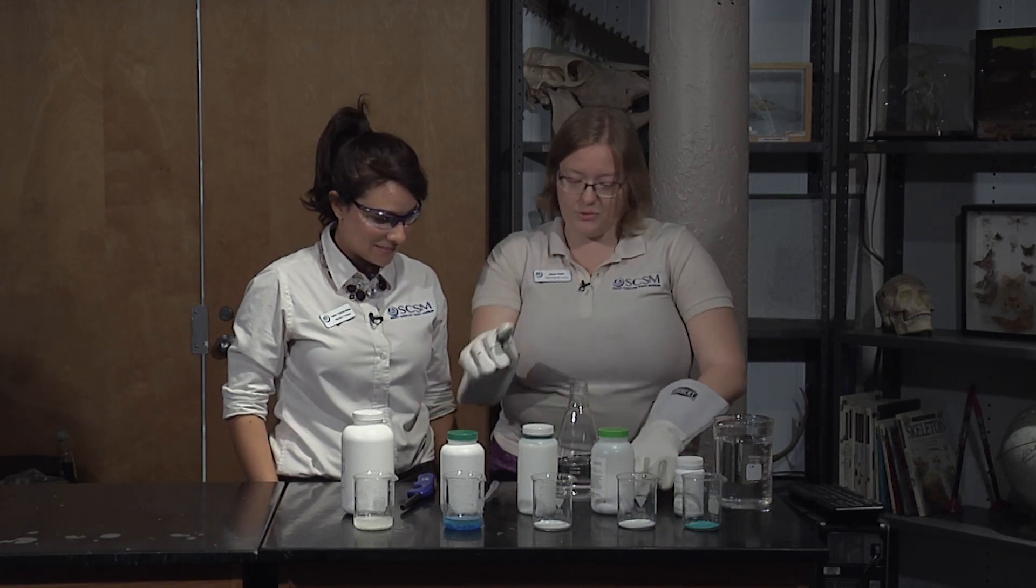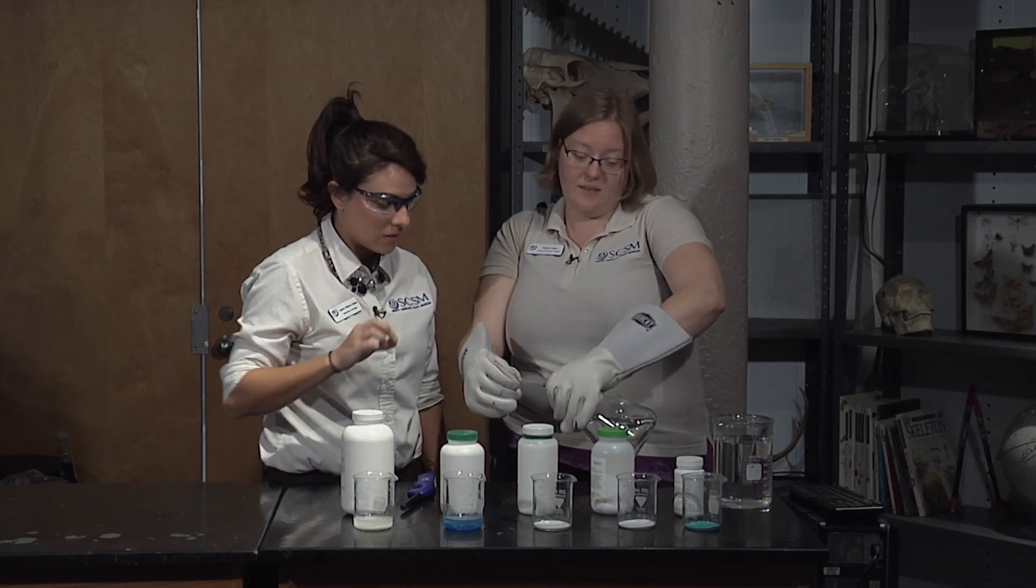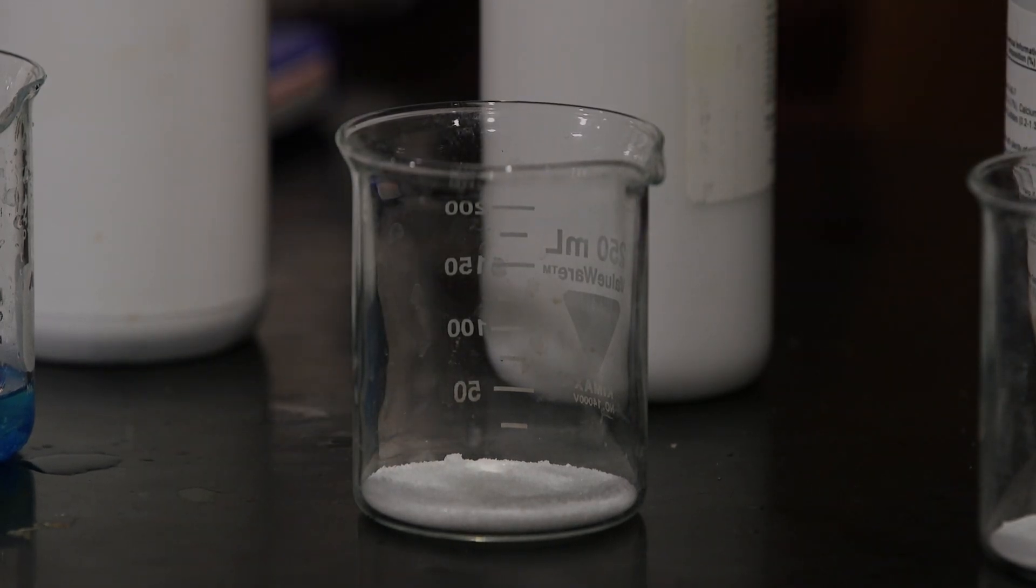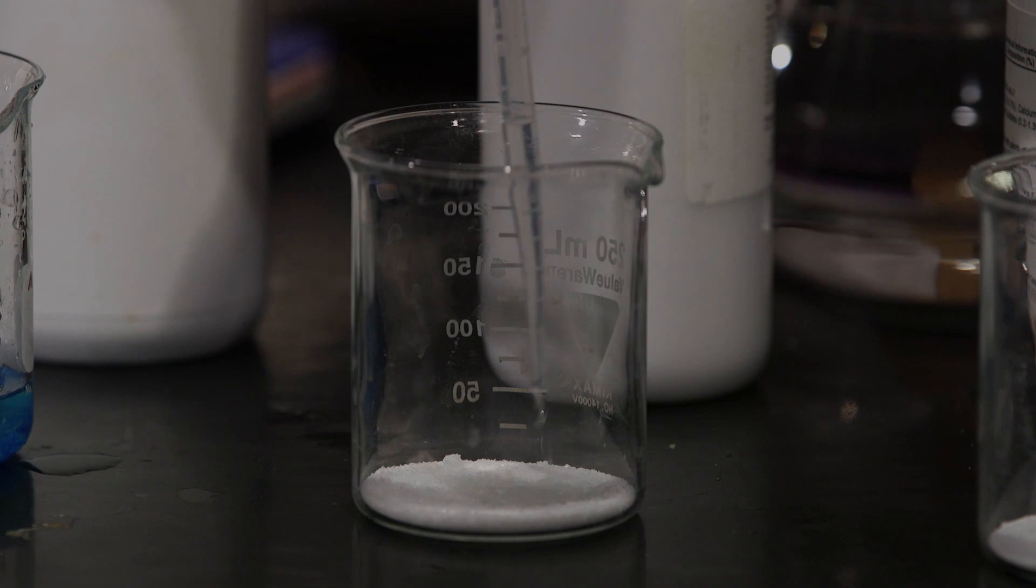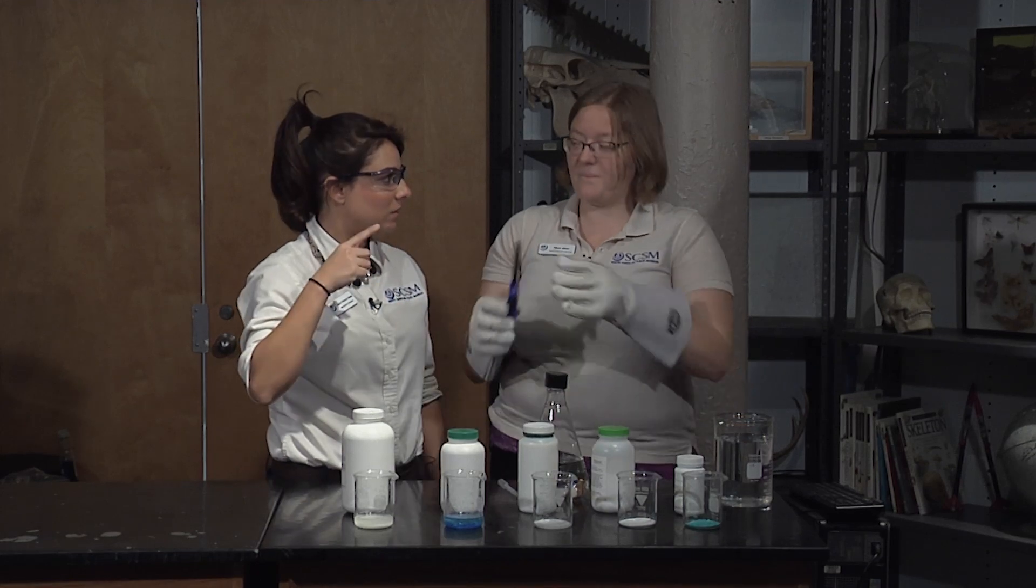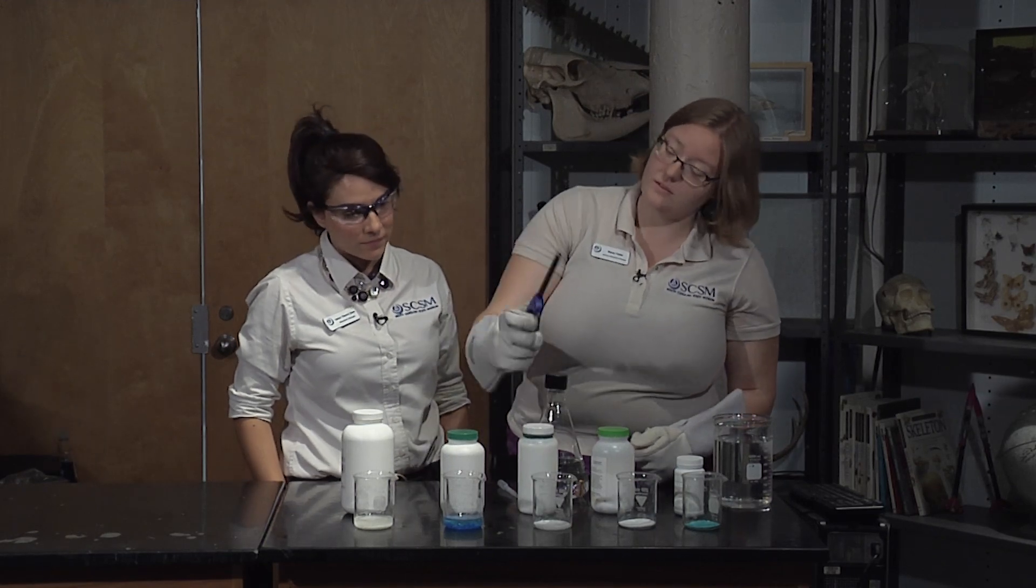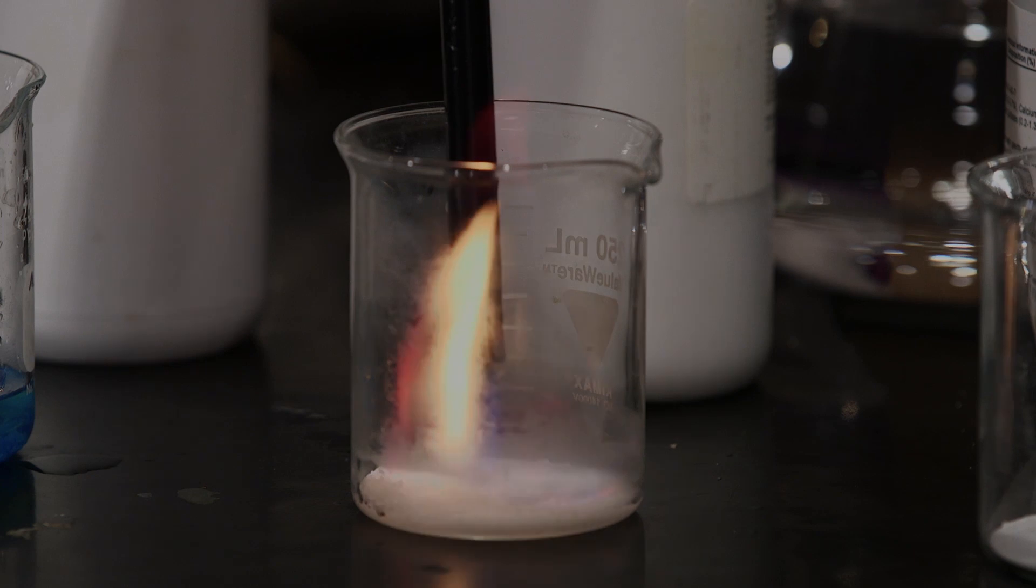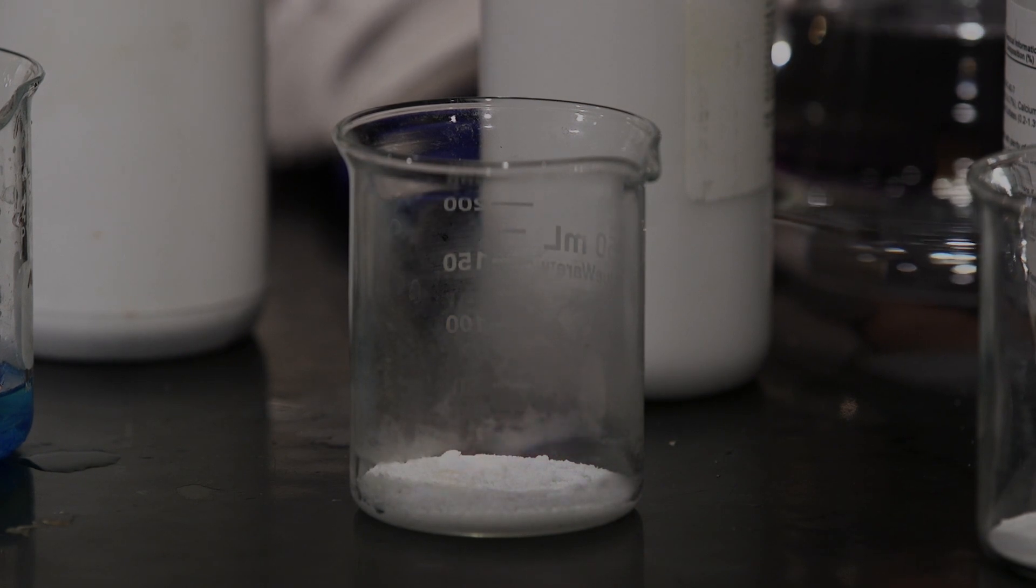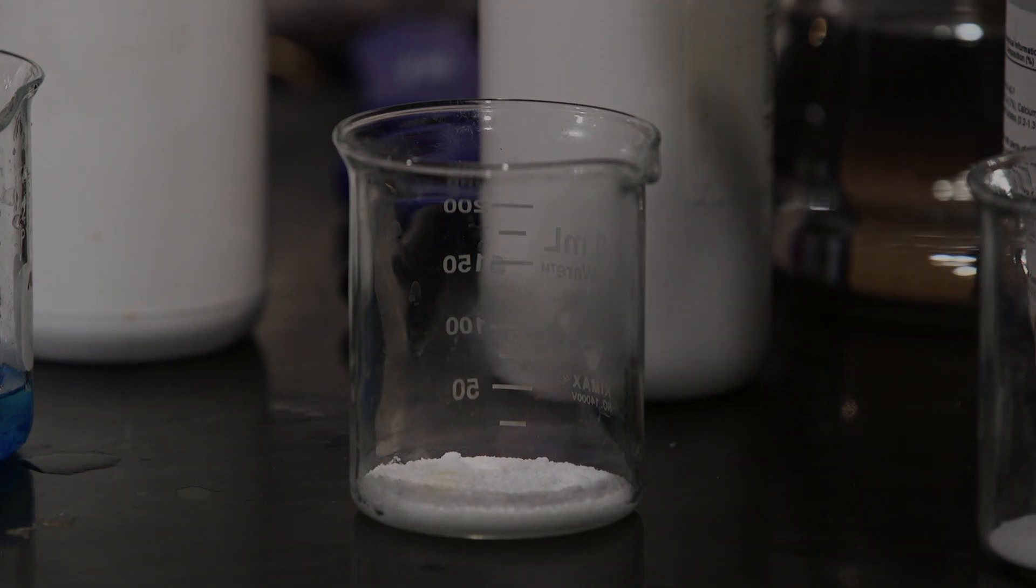And next we have our strontium chloride right here. That's another white one but the salt is a lot finer. Yes, it's a little smaller grain. And you keep capping it because the methanol evaporates quickly. So if we left this on, we wouldn't have very much left over. Oh, there we go. That's a beautiful red. Didn't even see any blue there. It went straight to red. That's great. All right. Let's get a little water in there, set that fire down.